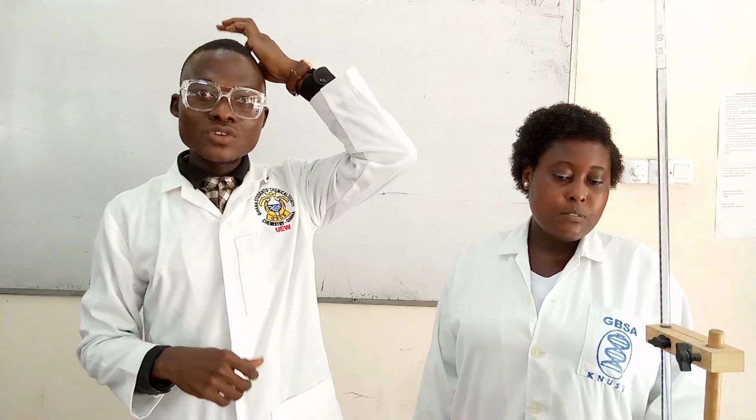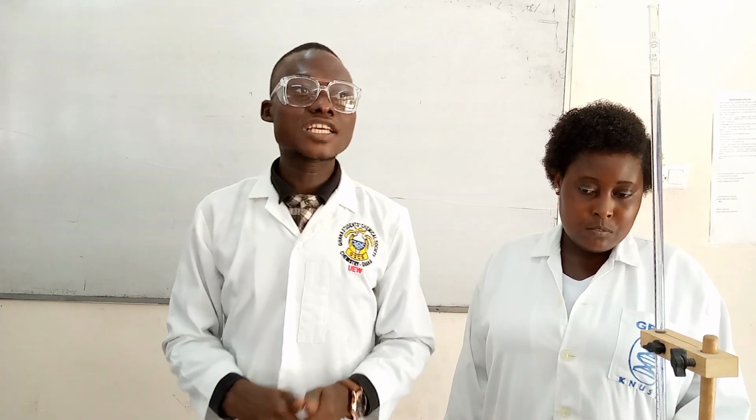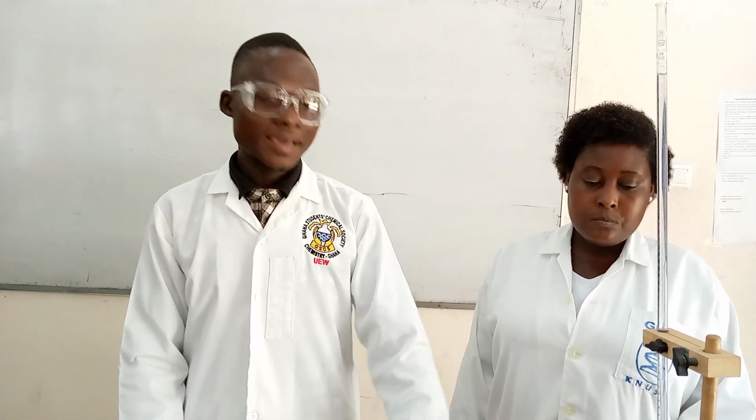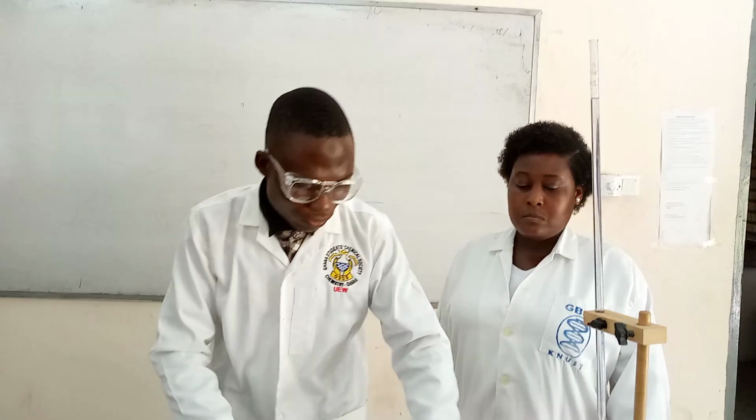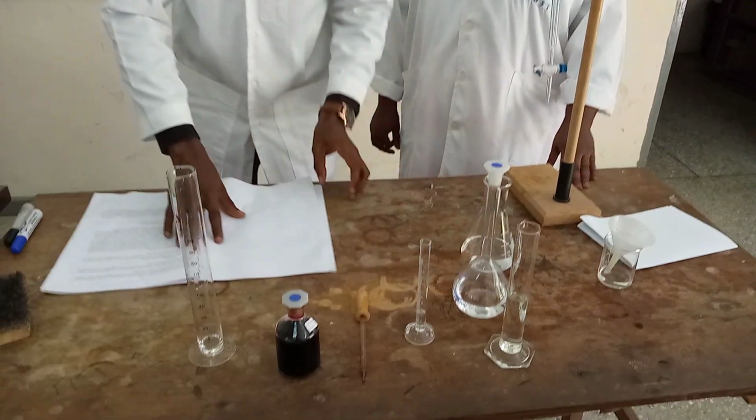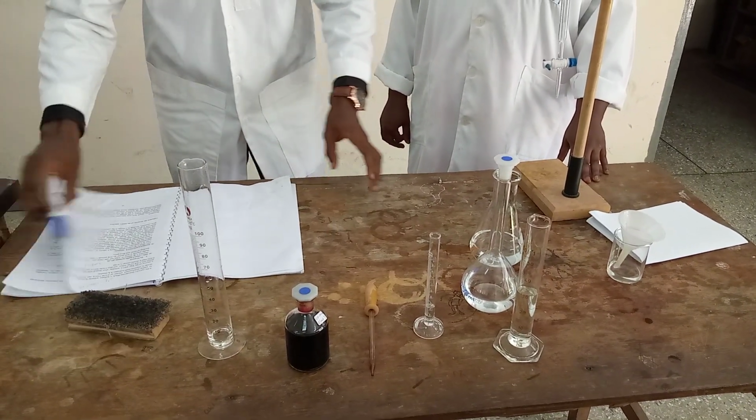And somebody might ask, why are you adding 2 ml of buffer solution? Please, the buffer solution is added to resist change of pH. Because the moment the pH changes, at the end you won't get your actual endpoint. And not only that, the metal ions in the water and the EDTA are all what? pH dependent. When you don't add the buffer, the pH of your solution can change, and at the end you might not get your actual endpoint.